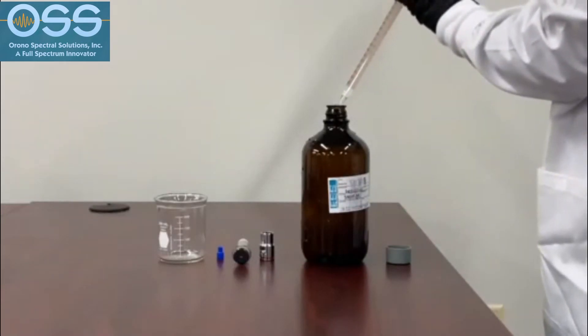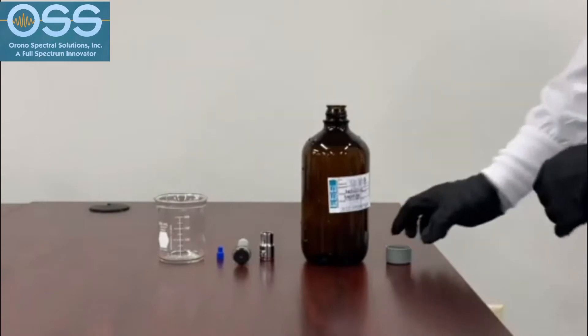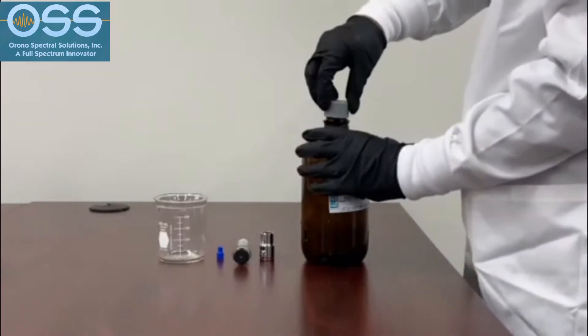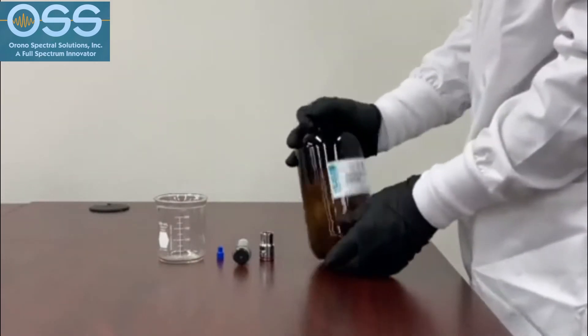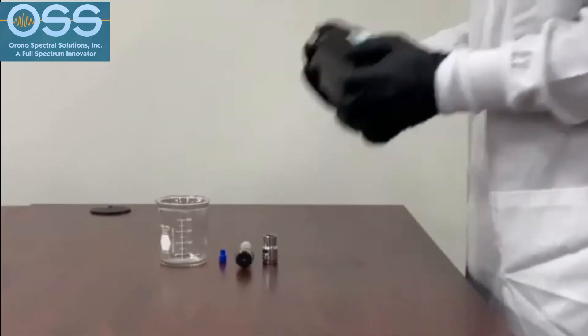First, adjust the sample pH to 2 or less using hydrochloric acid, and then homogenize the sample using shaking and sonication technologies.